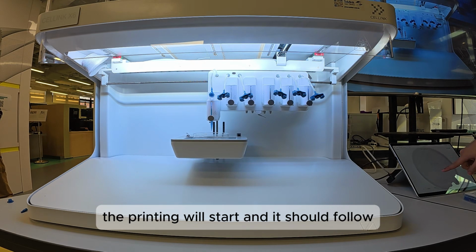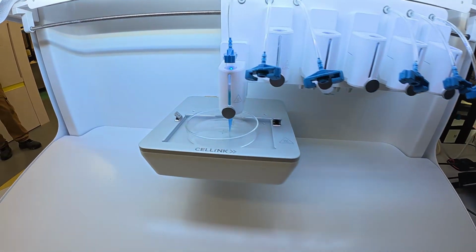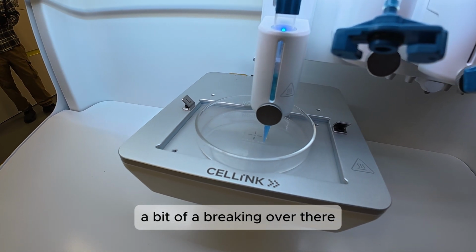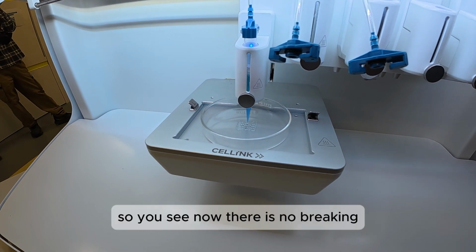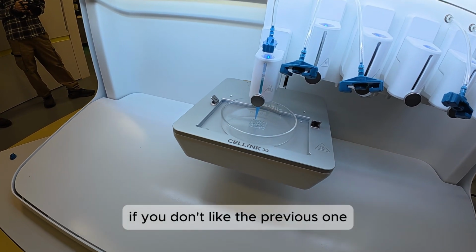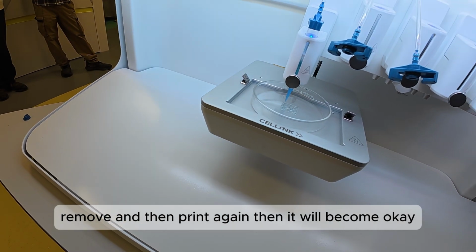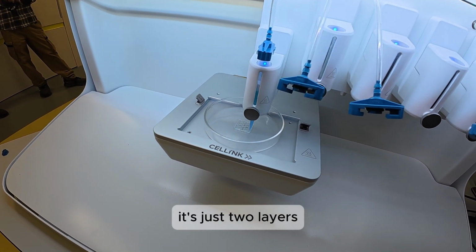Alright, so now you can click start, and the printing will start. It should follow, I think if you want to see, you see now there is a bit of a breaking over there. So if you want, okay, so you see now there is no breaking. I mean, if you don't like the previous one, you can always pause, remove, and then print again. So then it will become okay. But now the printing, we just leave it is just 2 layers.